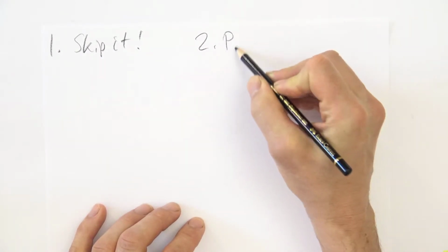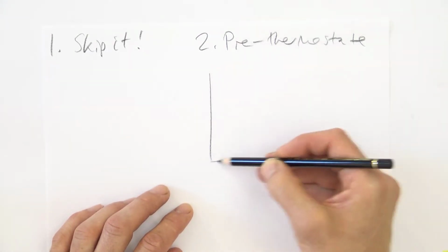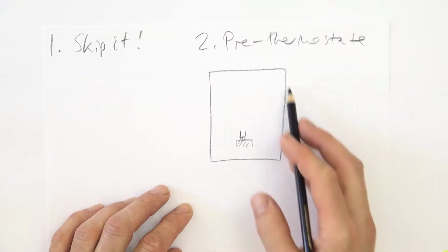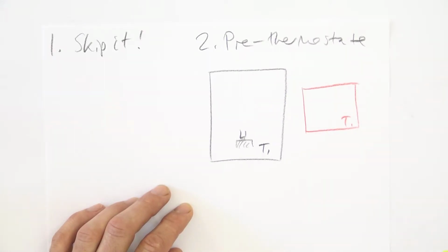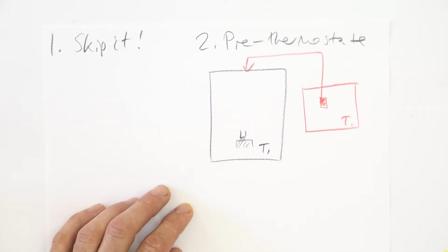The second thing that one can do is to pre-thermostate, so that the sample has the correct temperature, more or less, when it comes down into the calorimeter. So here is the calorimeter, or actually the thermostat of the calorimeter, and I will draw the calorimeter with its heat flow sensor and heat sink down here. So this schematic instrument is very well thermostated, and let's say it has a temperature of T1. So one thing that one can do is that we can get a second thermostat here with the same temperature, of course, and place our sample there during some time before the measurement, and then when we start the measurement we charge it into the calorimeter. Then it has more or less the same temperature as the calorimeter, and this will reduce the initial disturbance.